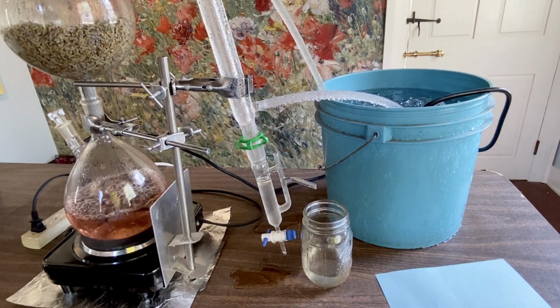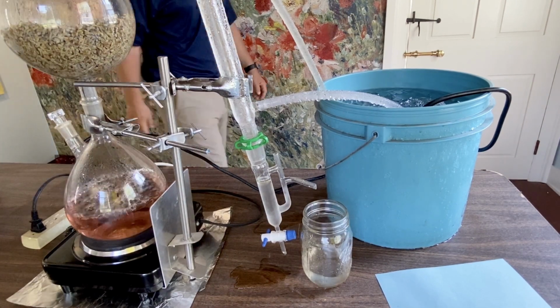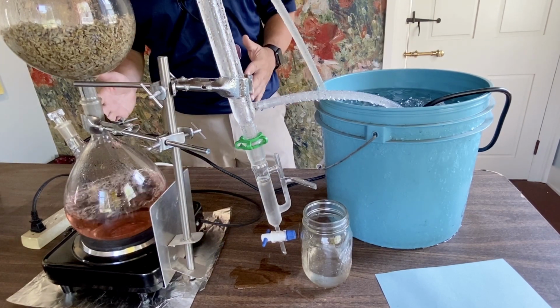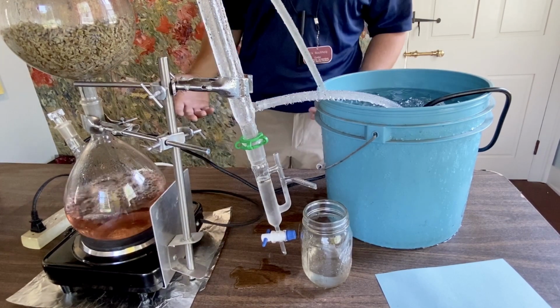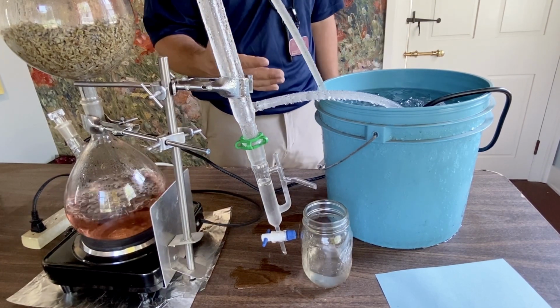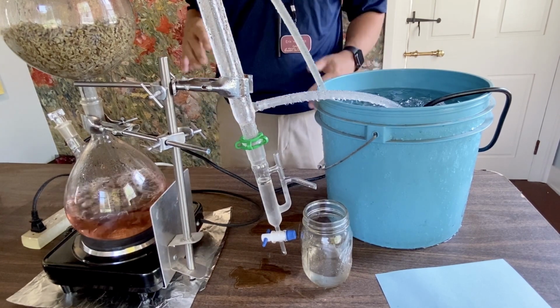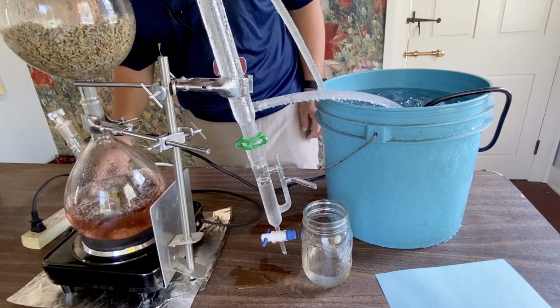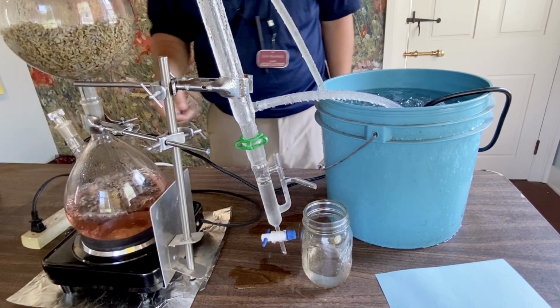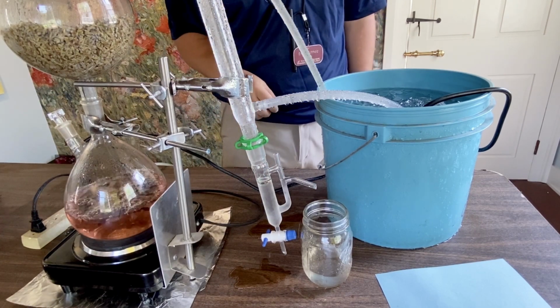Okay, everyone. So I often will crank this for about 2 hours. And that's usually on average the sweet spot. At least that's my comfort zone. Everyone's different as they gauge the rate of production, and soon enough that production slows down. So 2 hours at this point, I'm going to shut down the heat and we'll get a little bit closer to that oil layer and I'll show you how we get that oil out.